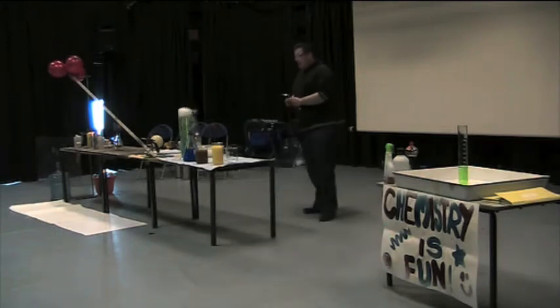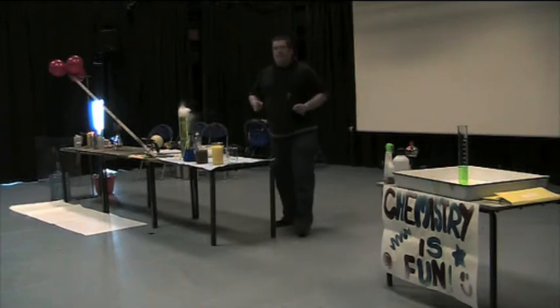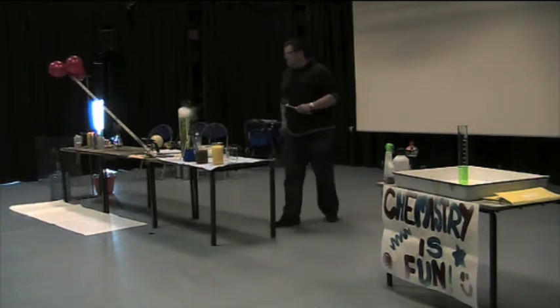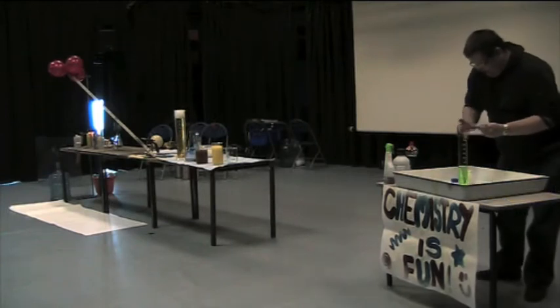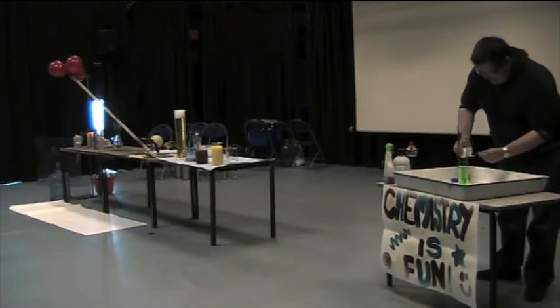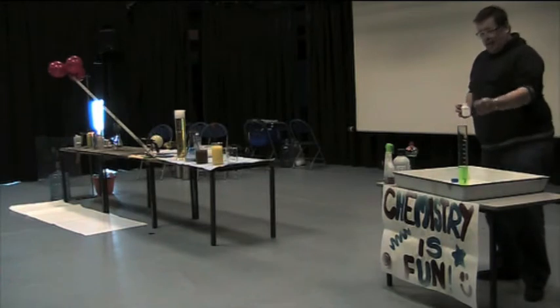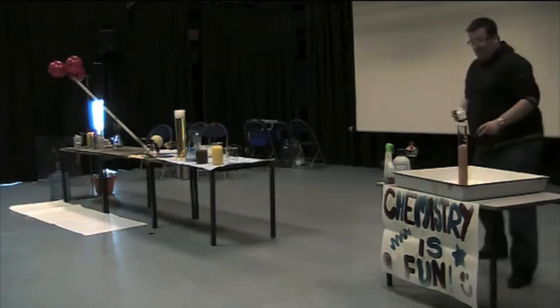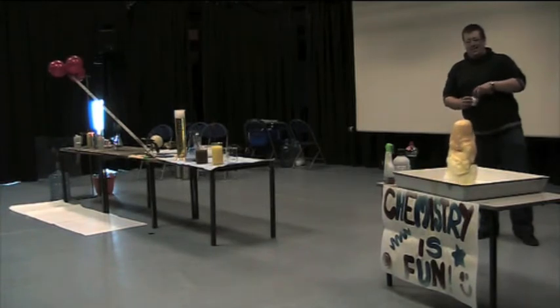Okay, so how many of you have ever done a titration at school in chemistry? None of you yet. Okay, well, you will do at some point, and it'll probably bore you silly. But when you do, this is a slightly more interesting version of a titration. Okay, so there's a good glug of potassium iodide, so I'll drop that in. Wow. Oh my God.